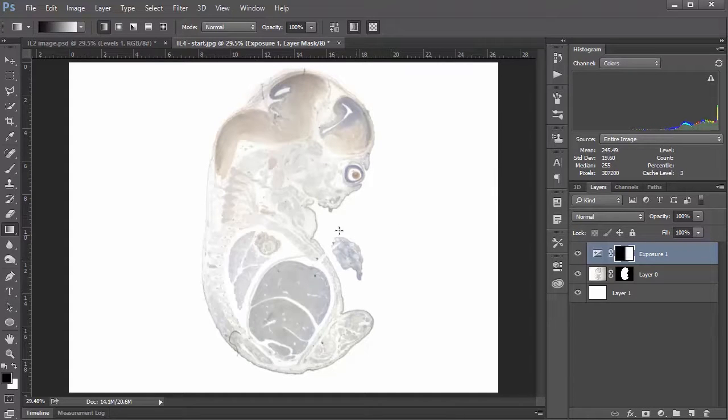You might have to do this a couple times. You can just click and drag as many times as you like. For example, you can click wherever you want. But ultimately, you're looking for something that kind of balances things out, and to me, this looks like the effect I'm trying to achieve here.